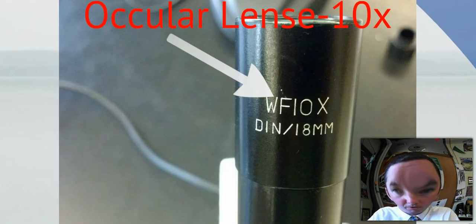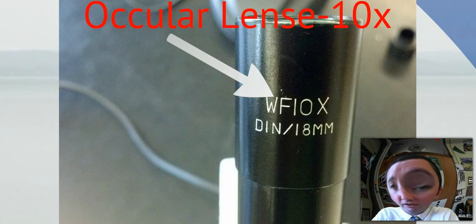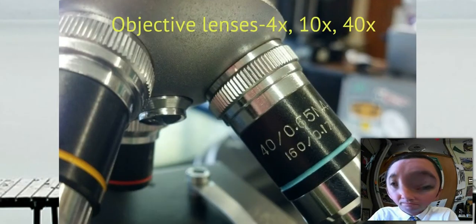So let's start with some of the parts. First one you're going to be using is the ocular lens. All right, it magnifies about 10 times what you can see with your eyes. You'll notice a couple numbers on the screen. You'll see this nice WF 10x. That actually tells you the magnification. For all of our concerns, we're not going to worry about the other numbers.